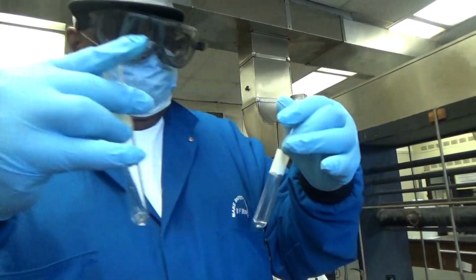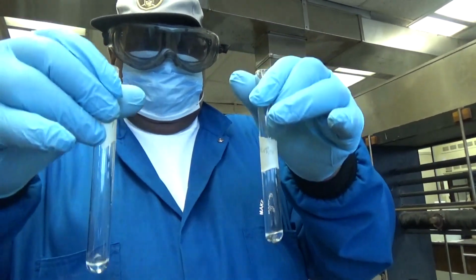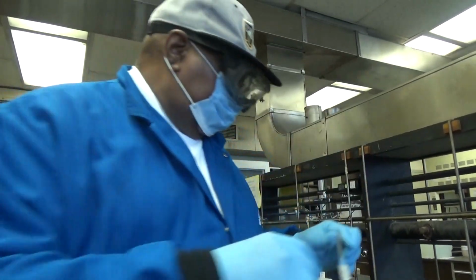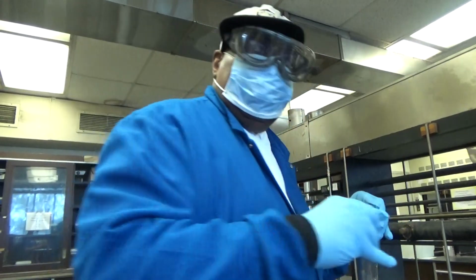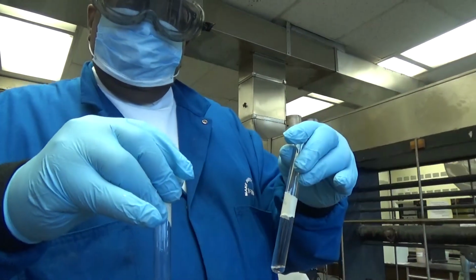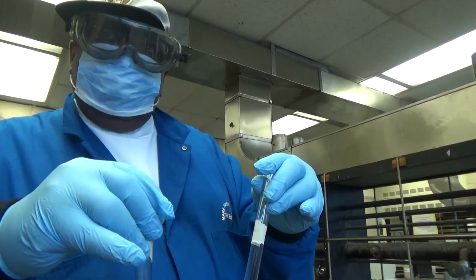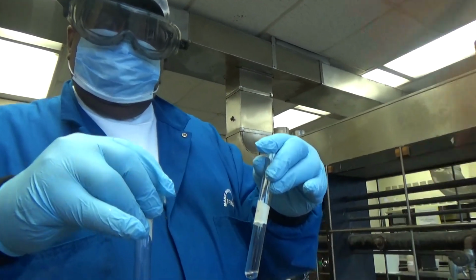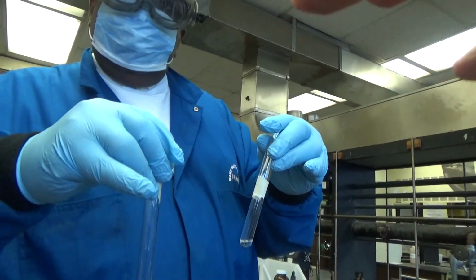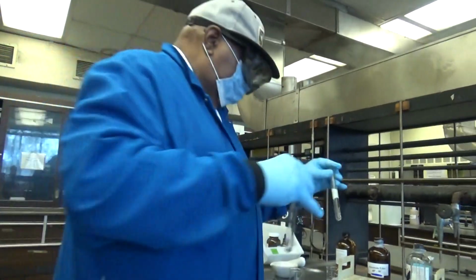You need to discard acetone and 95% ethanol because they completely dissolve benzoic acid at room temperature. So they're unlikely to crystallize out if you cool them down. Therefore you need to throw them away because they're too good of solvents. For crystallization, they're bad solvents.